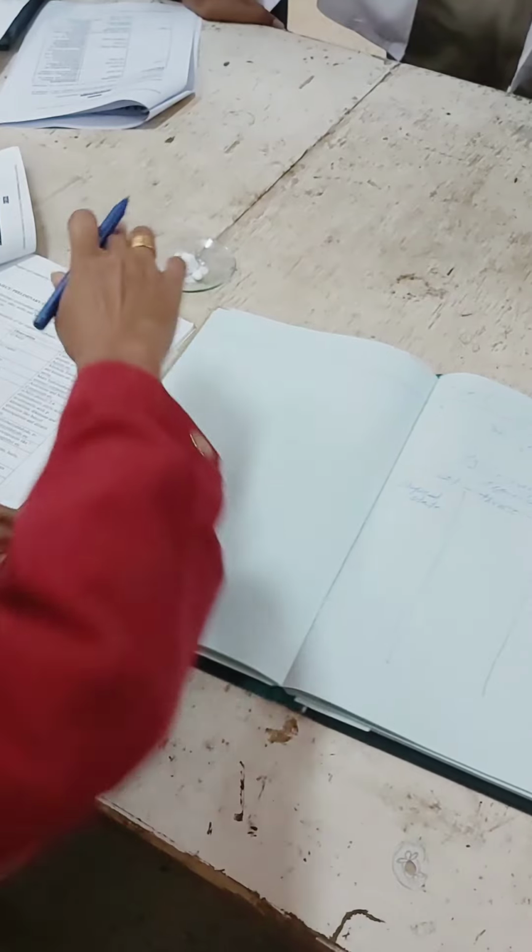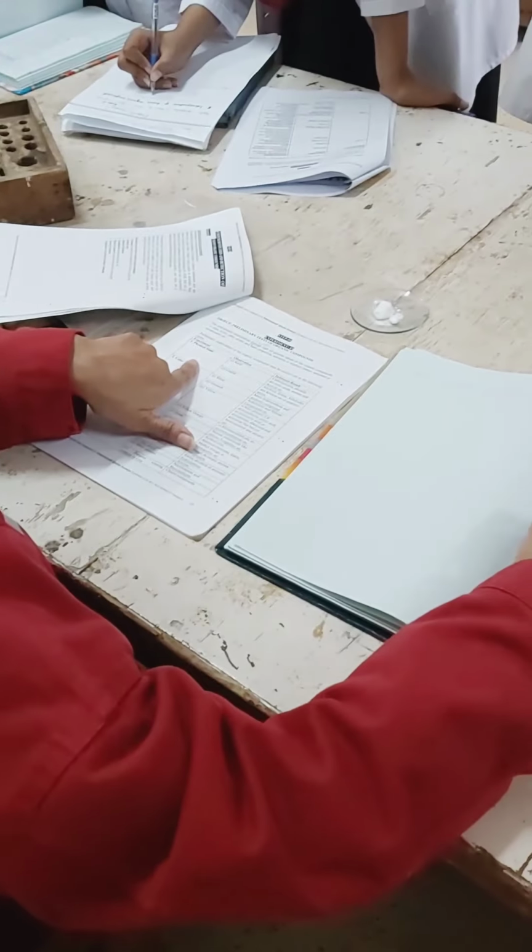And now you are going to do the preliminary examination of what? Of this compound. We are identifying this compound. We are doing the preliminary examination of this compound. Now what is the preliminary examination? The very initial examination. शुरू में जो की जाती है. This is called the preliminary examination. So what it tells us, the physical state.